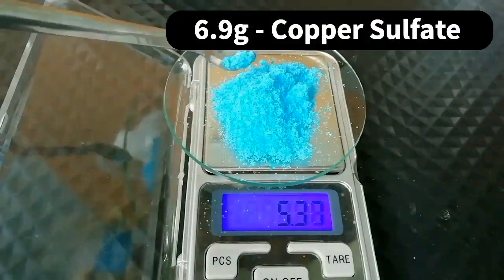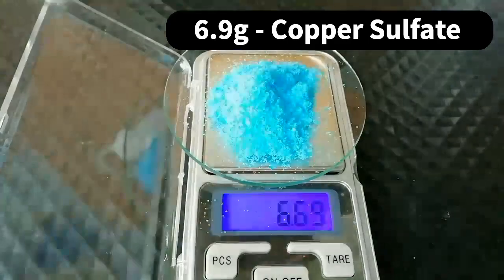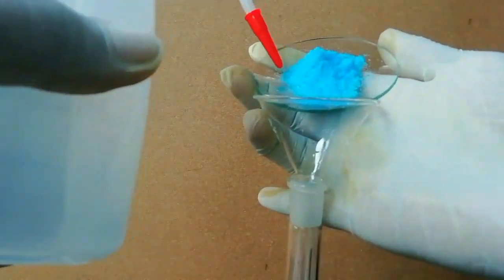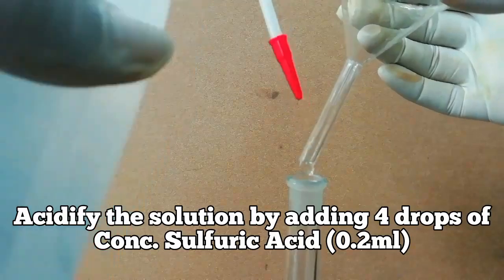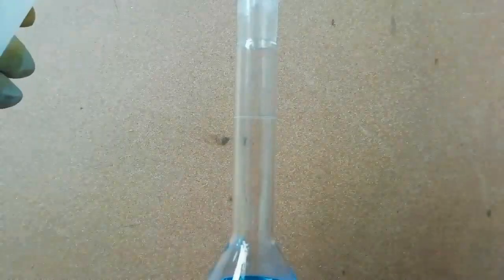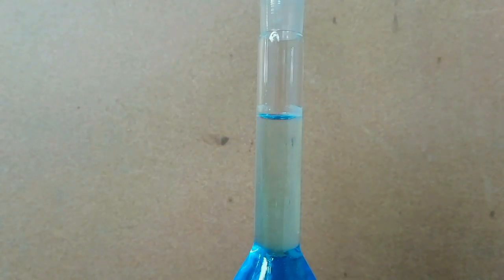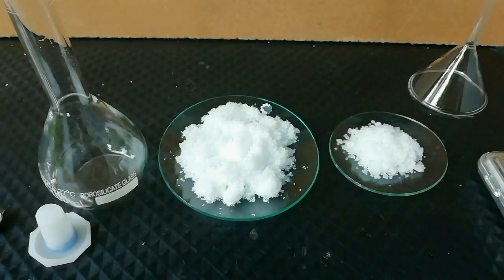First, I measured 6.9 grams of copper sulfate and dissolved it in water. Then I added 4 drops of concentrated sulfuric acid to acidify the mixture. Water is added to the mark of 100 milliliters of the volumetric flask. This solution is called Fehling's A solution.